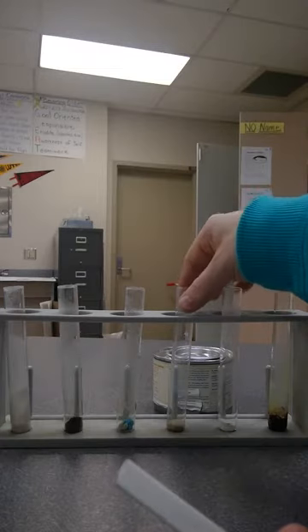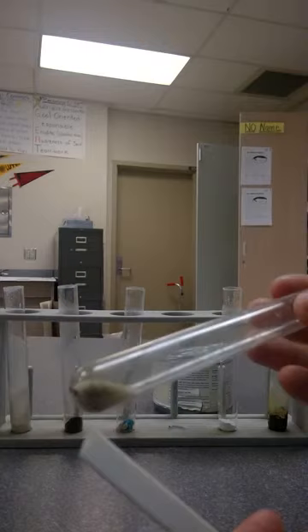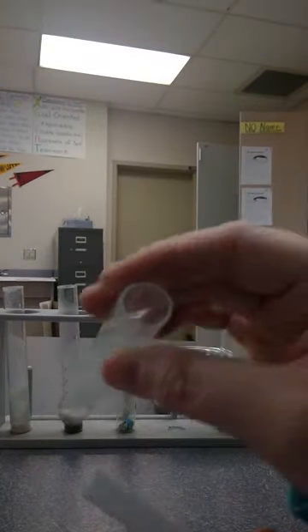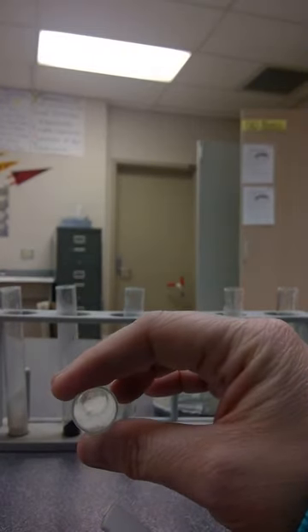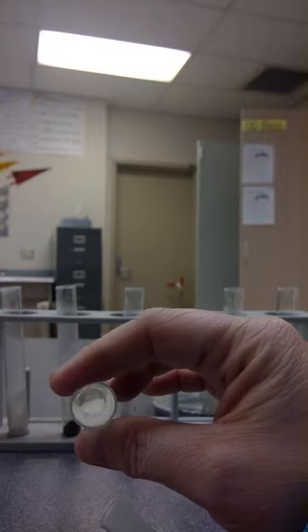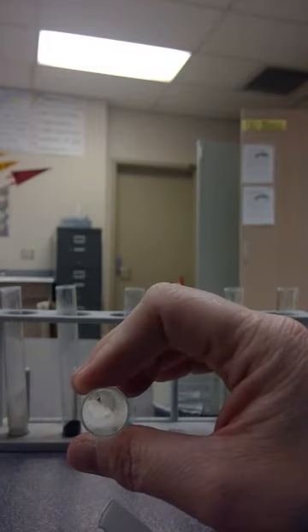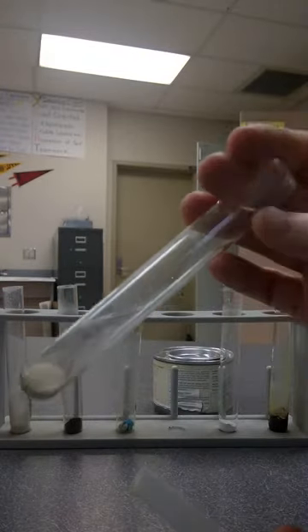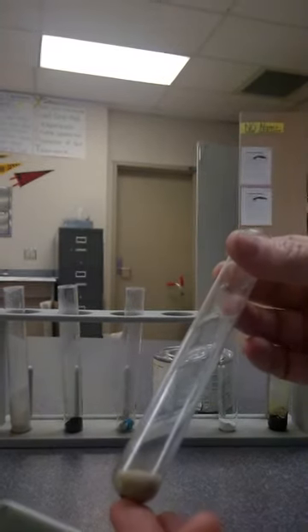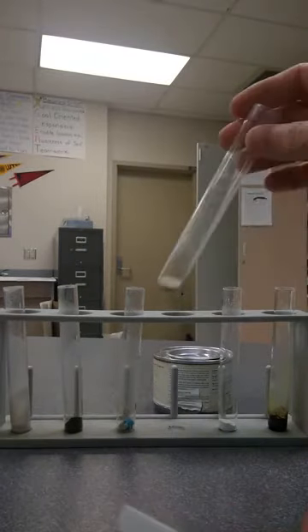Here's our sodium chloride. The test tube turned a little bit brown, but inside the sodium chloride looks exactly the same — it had absolutely no change. You can see it's white, and there's a little bit of color on the outside from heating the test tube. But the inside still looks just like table salt, absolutely no change, no color. Throughout heating and cooling, this substance did not change at all.